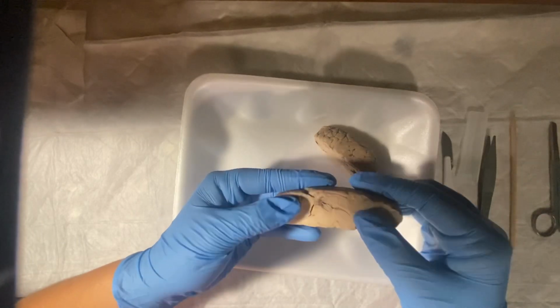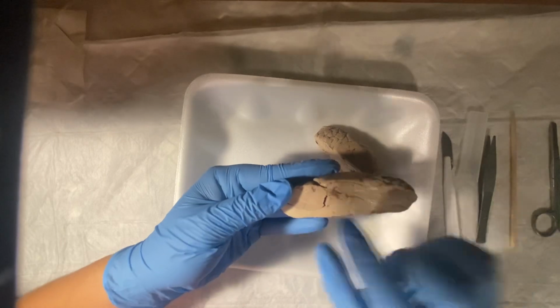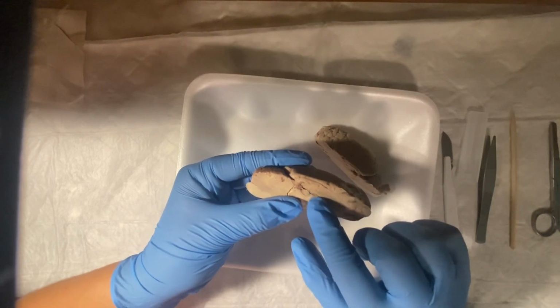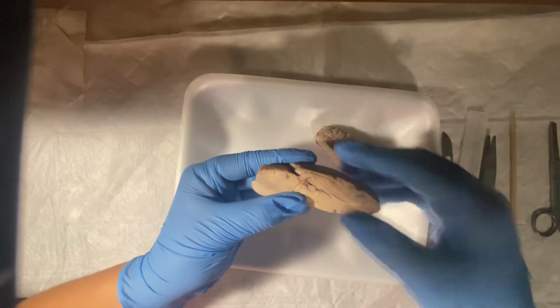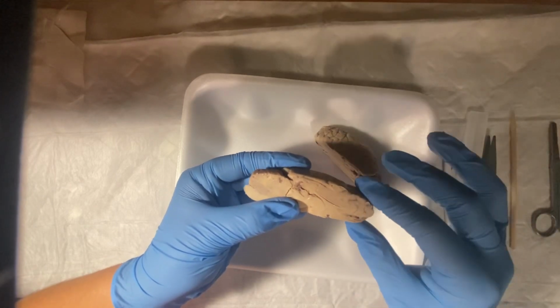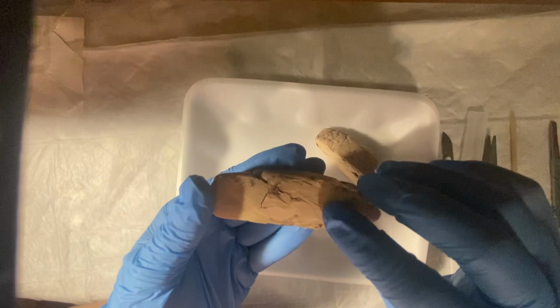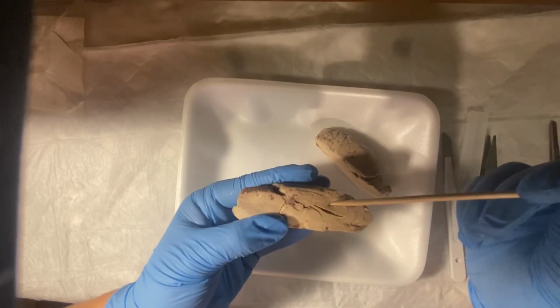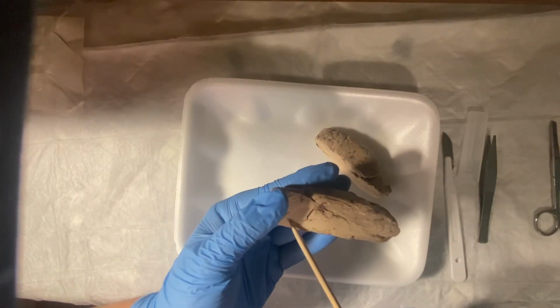Okay, well, I know that our fourth ventricle is right underneath the cerebellum, right around here. There we go. And then we have the third ventricle. That is right here, that line. And our lateral ventricle would be this one right here. And there's our third ventricle and our fourth ventricle down here.